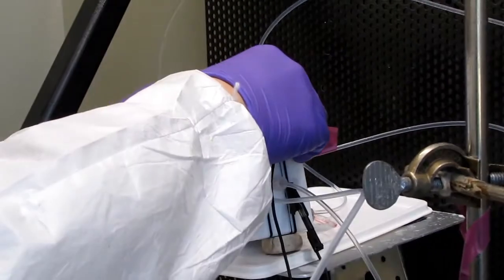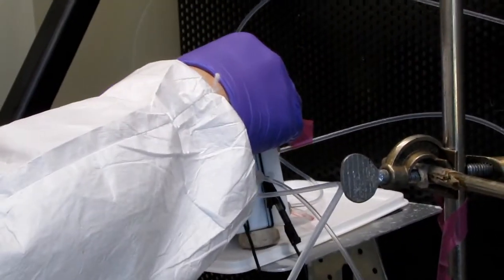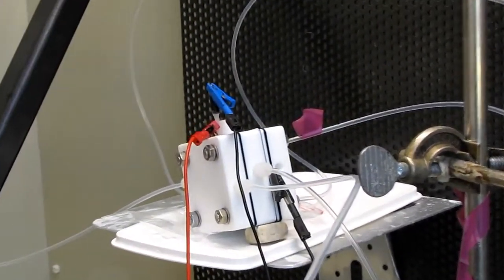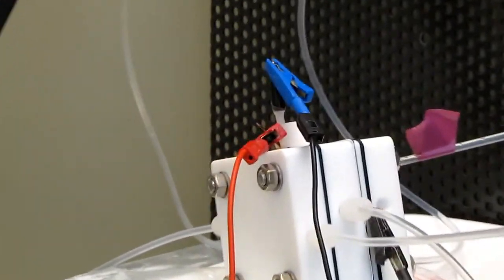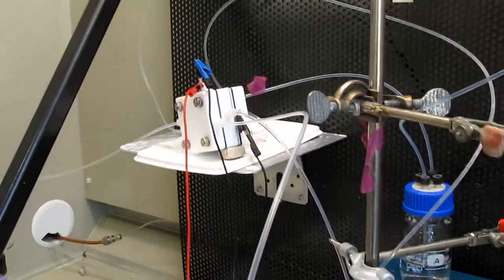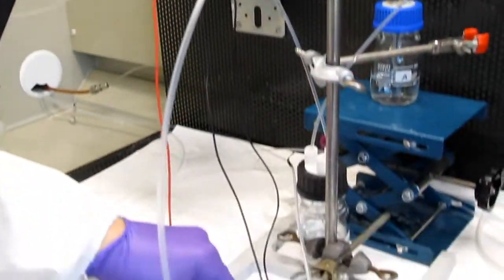We use three-electrode measurement. Three wires, like this. Reference and counter.